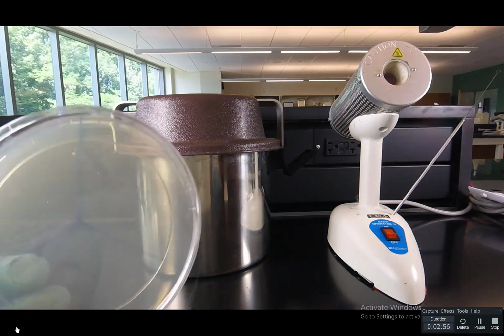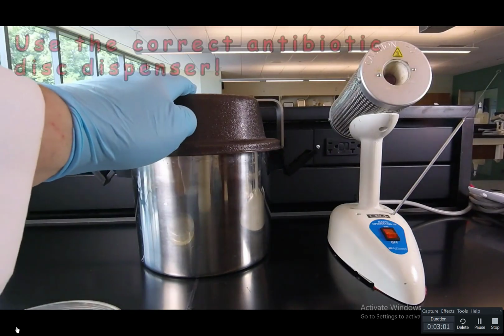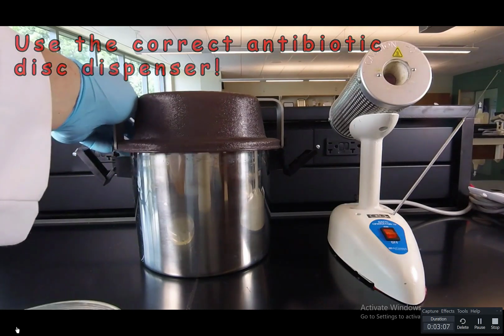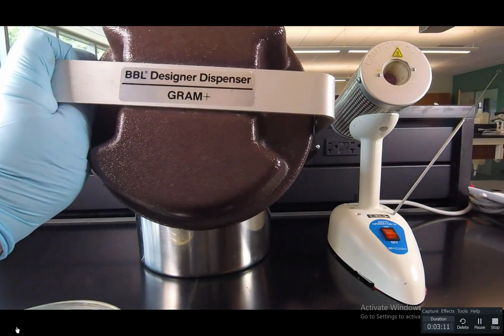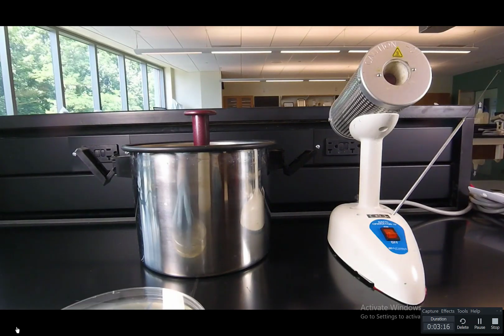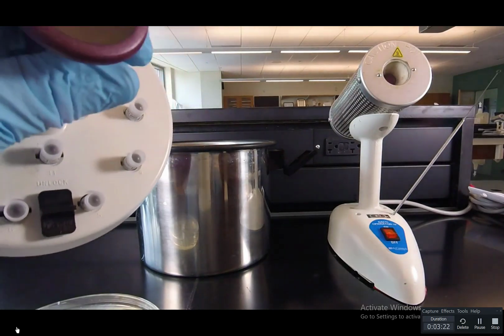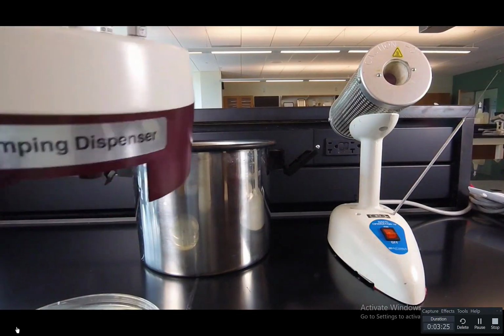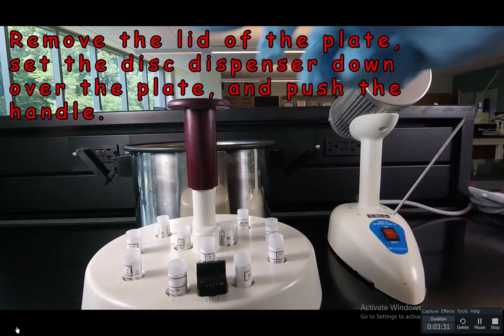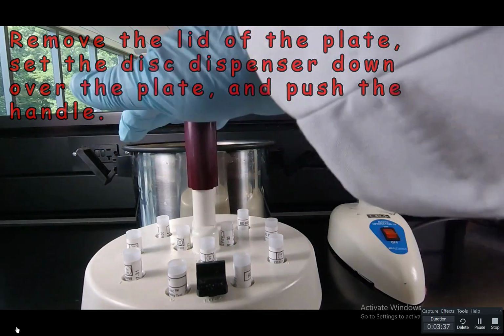Now, since this is Enterococcus faecalis, a gram-positive bacterium, we're going to use the antibiotic disc dispenser that contains antibiotics often useful against gram-positive bacteria. You see that the lid is labeled gram-positive. So, very simple to put on the antibiotic discs. We remove the disc dispenser. It also says gram-positive on the handle. And we're going to take the lid off of the plate, put the antibiotic disc dispenser down over the plate, and push down firmly on the handle.